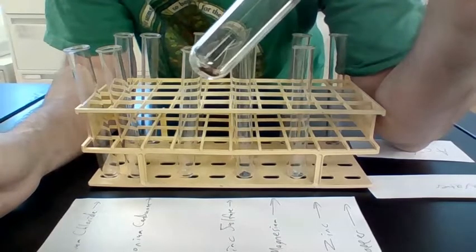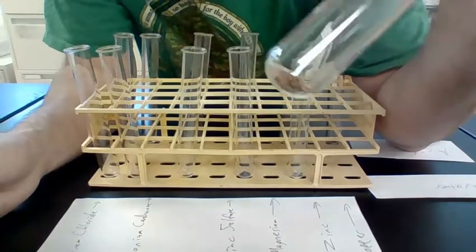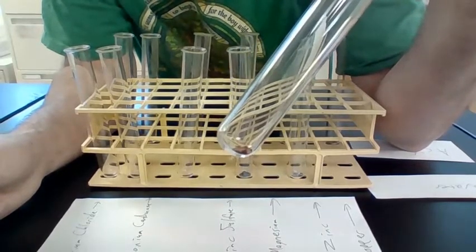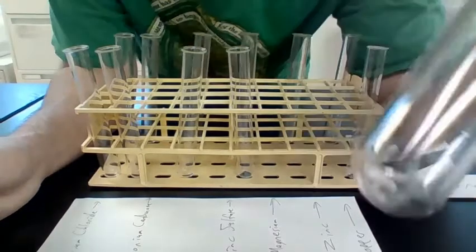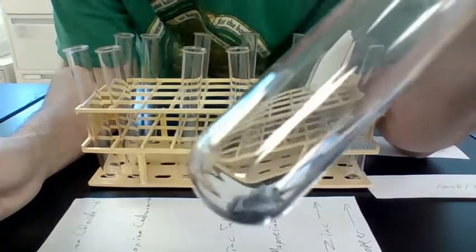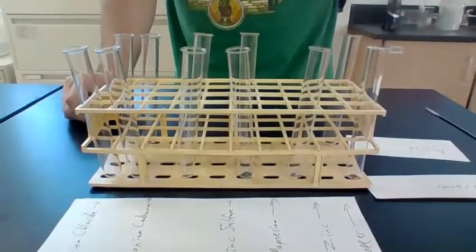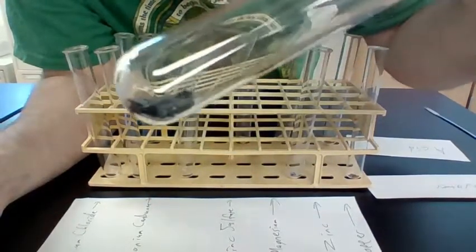Now on our lab sheet, we are going to make observations about what this copper looks like. I don't know if you can see it really well, but it looks solid. It looks orange. They're in the shapes of little balls. The zinc looks a little bit different. It's more silver. It has more jagged edges. And the magnesium looks solid, less silver, more gray, and more rounded edges.